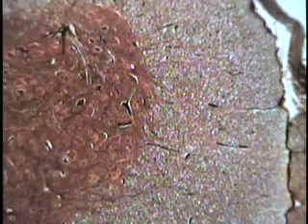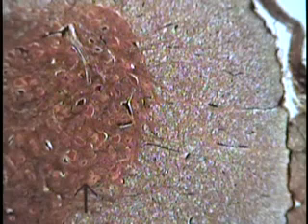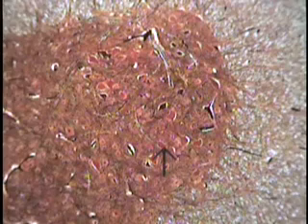Another excellent place to look when examining very large cells is within the spinal cord. This is a section of spinal cord. This large area is largely made up of what is referred to as white matter. The place to look to identify very large cells is in the ventral horn of the gray matter, which lies at the interior of the spinal cord. Even with the scanning objective, these irregularly shaped objects are large cells referred to as neurons, of the same size if not larger than the ova.